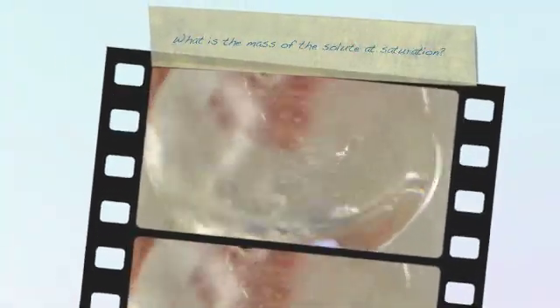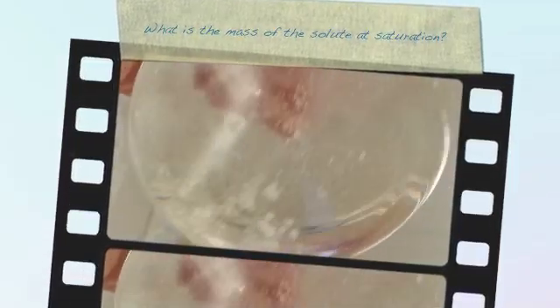So we're at cube 37. Now our 75 mils of water looks like it's significantly more now. It's more viscous and the cube is not dissolving. It's not even breaking apart. So because the crystals don't want to break apart and because the molecules of solute are not dissolving into the solvent, we've reached our saturation point. Meaning we should be able to identify the solubility of the substance or the concentration. So when the volume doesn't change, we should be able to identify concentration of solute in solvent. That will tell us our solubility. So you'll notice that on the 37th cube, even after waiting 20 minutes, we can see the cube is broken down, but all the little fragments of sugar crystals are still sitting throughout the solution. They're not dissolving. So again, we've reached our saturation point. No more sugar molecules are being dissolved. No more solute is being dissolved into the solvent.